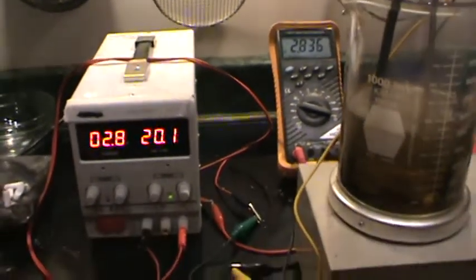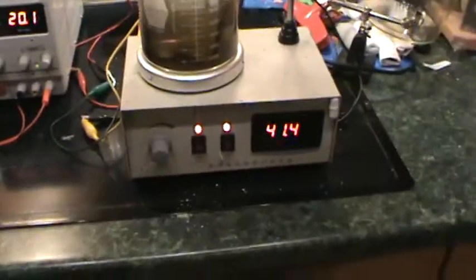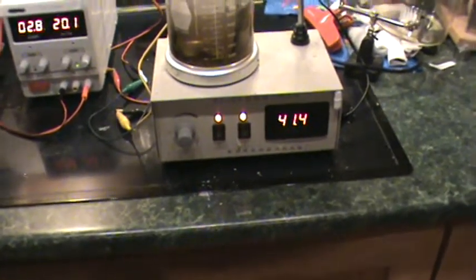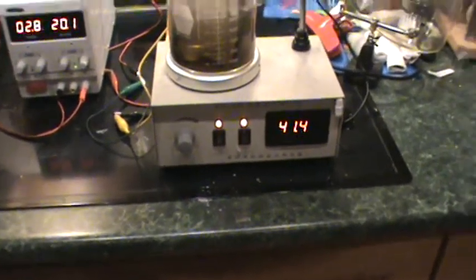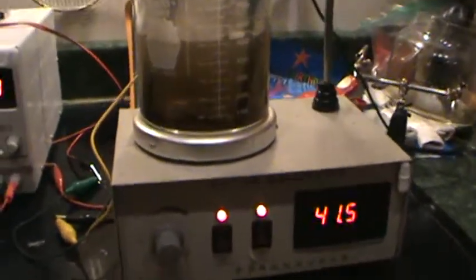It's probably due to the conductivity of the solution. I started at 30 degrees C and the solution's warmed up.